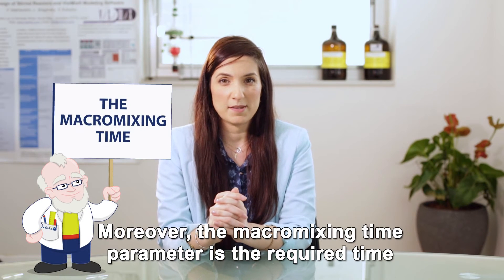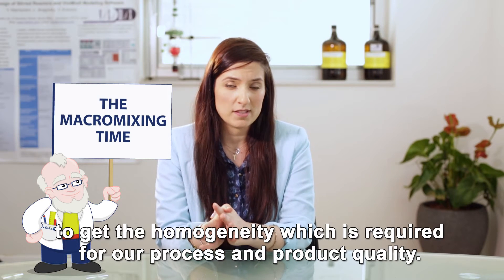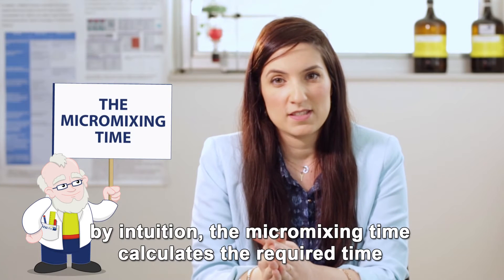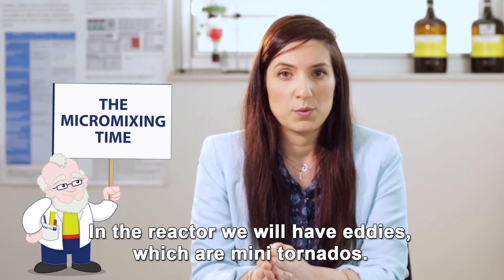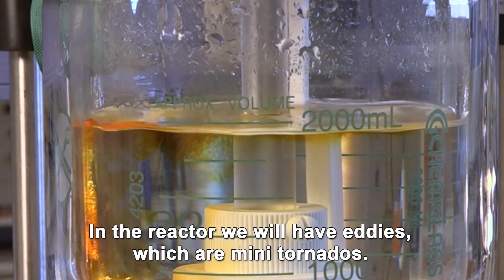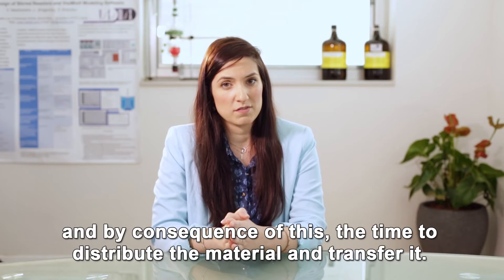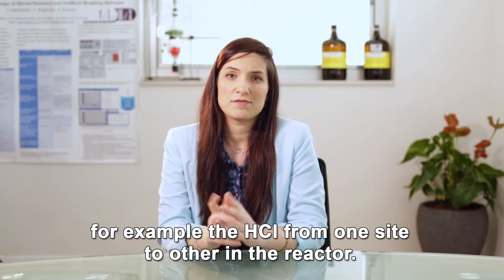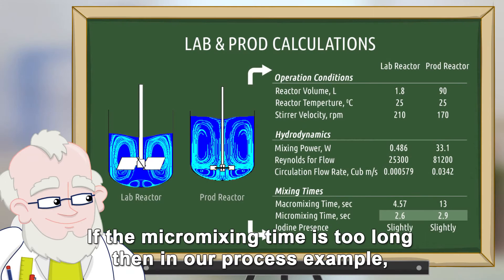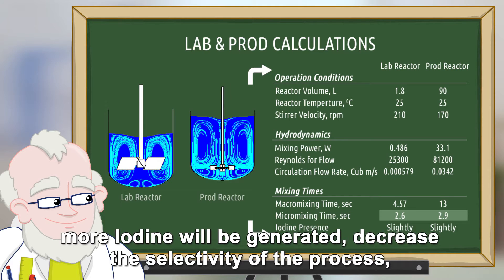Moreover, the macromixing time parameter is the required time to get the homogeneity required for the process and product quality. By intuition, the micromixing time calculates the required time to get homogeneity at the local level. In the reactor we will have eddies, which are mini tornadoes. The micromixing time will tell us the time required for this eddy to disappear, and by consequence, the time to distribute the material and transfer it — for example, the HCl from one side to the other in the reactor. If the micromixing time is too long, then in our process example, more iodine will be created, decreasing the selectivity of the process, and the quality of the material will be poor.